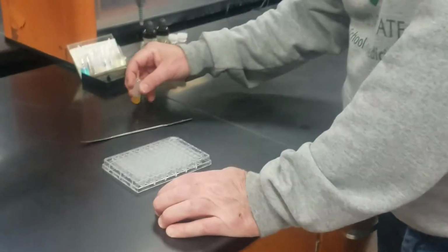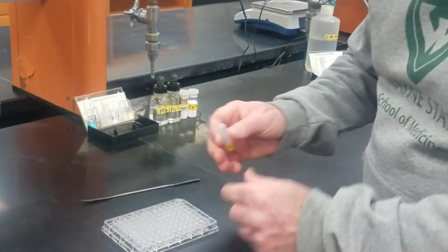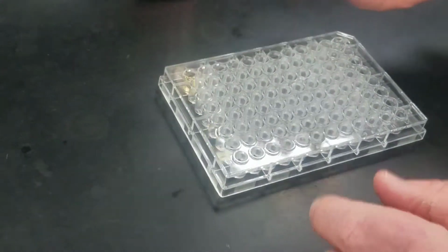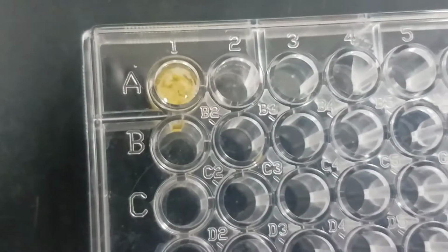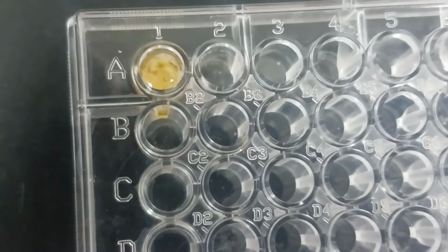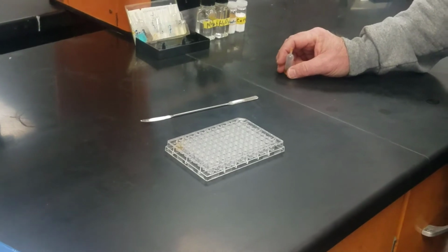All right, so the first experiment is we're going to take number one, which is iron chloride, and I'm going to put 2 drops in A, and then sodium phosphate, and I add 2 drops to it, and then I write down what I see. It looks like it's gotten cloudy, so I would write down that it's got a cloudy precipitate. You should write down what you see in your lab book.